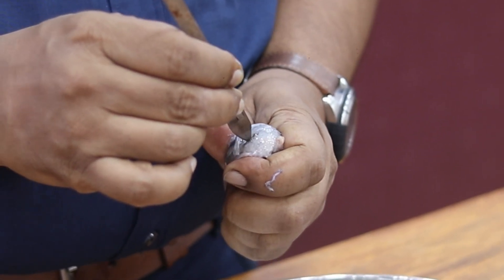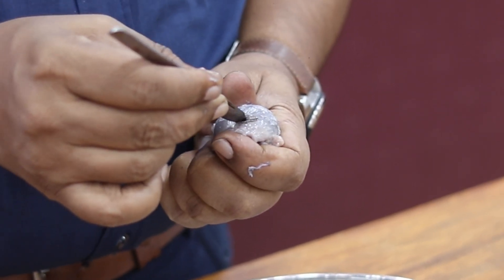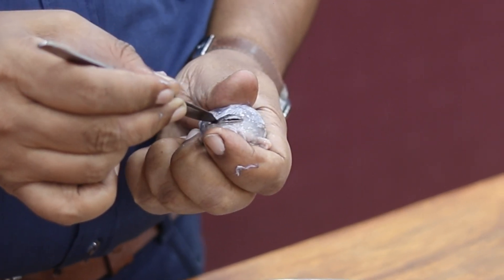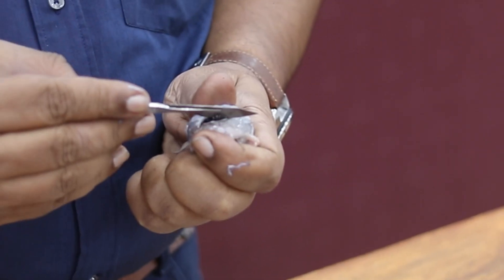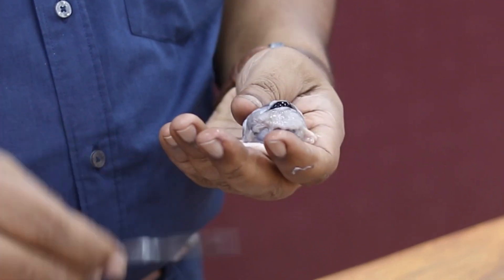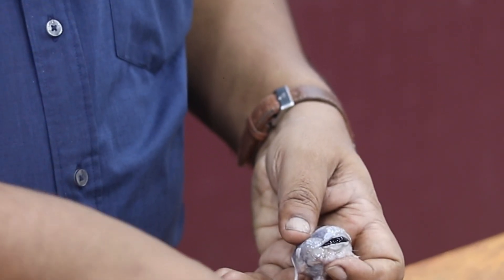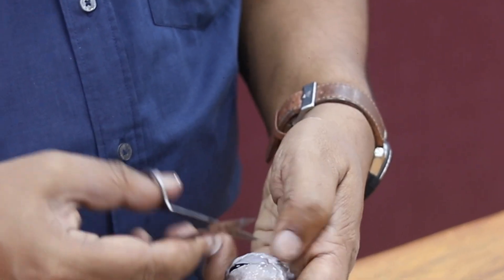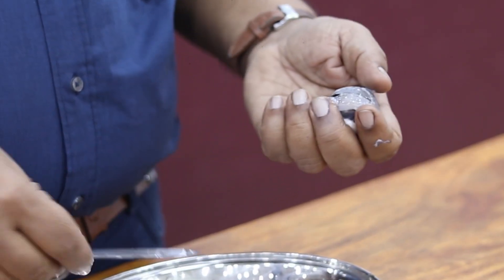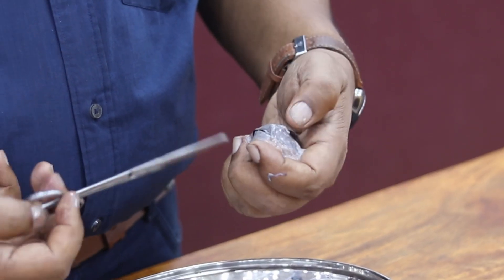I've put an incision and I'm carefully cutting along it. My plan is to slowly open it up using scissors. Vitreous means glass — this is really glass-like on the interior. The inside is glass-like and transparent.